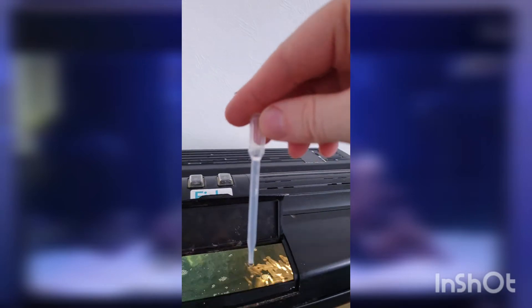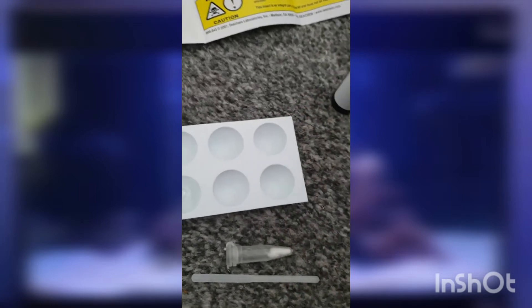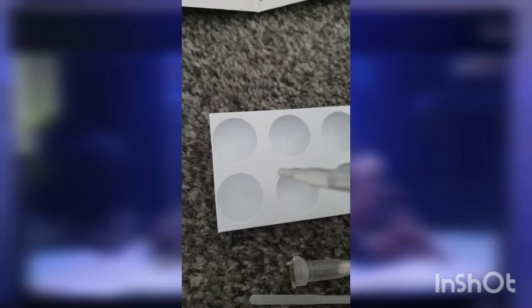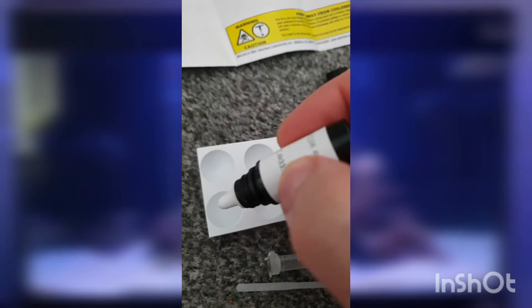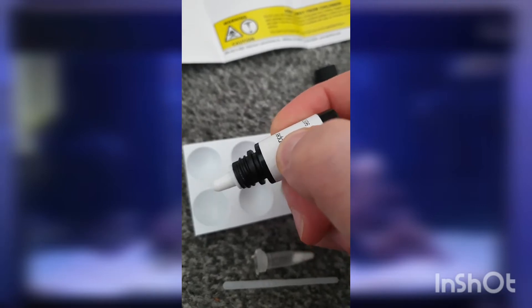So I'll show you how to do it. Get a pipette, put a little water to the tip of the bulb — it's just a false squeeze. Put it in there, same again like so. Now I don't really get it because that is literally filled to the brim, so get that tiniest little dribble back out — maybe I put a little bit too much in. The idea is you need to be able to put two drops of this solution in, so you need room for two drops. One, two — like so.